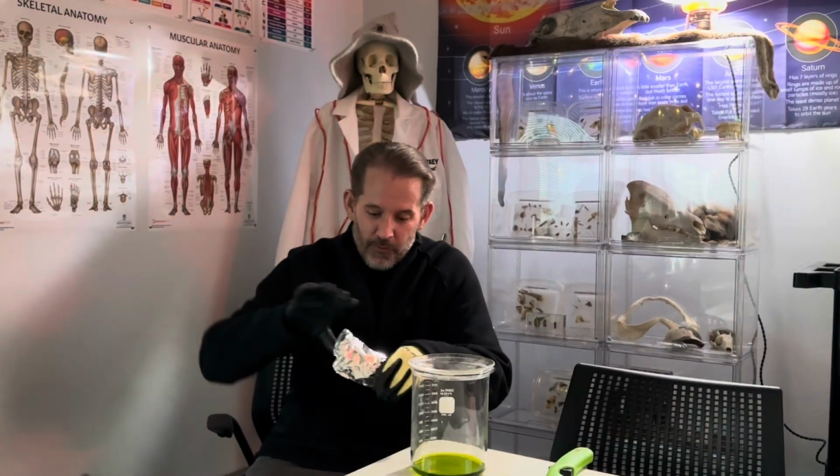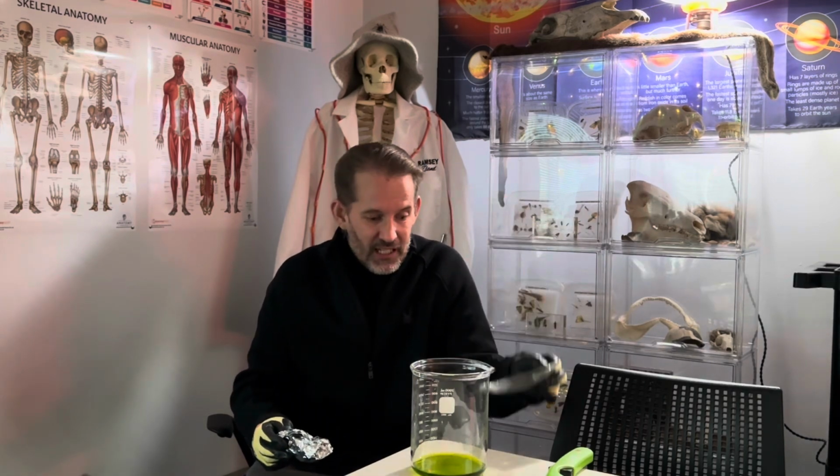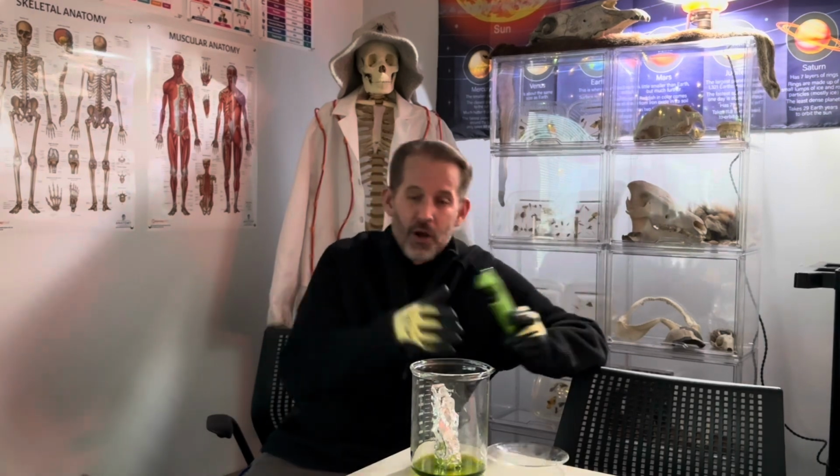Okay, now we're ready for the exciting part. I'm going to take my aluminum foil and crumple it up, and I'm going to remove my watch glass. When I put it in the hydrochloric acid, it's immediately going to release hydrogen gas. When you ignite that hydrogen gas, you'll get the most amazing blue flame. When I want the flame to go out, I'll just cover it with my watch glass to snuff the flame.